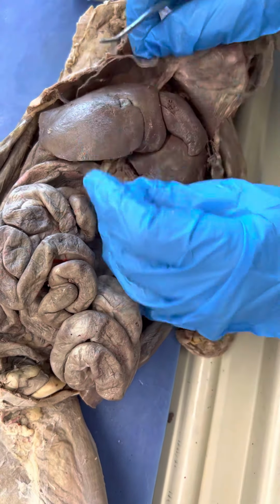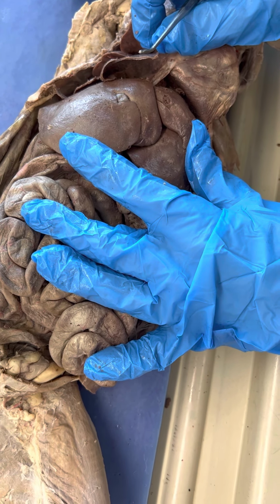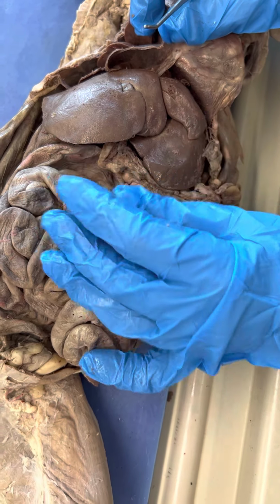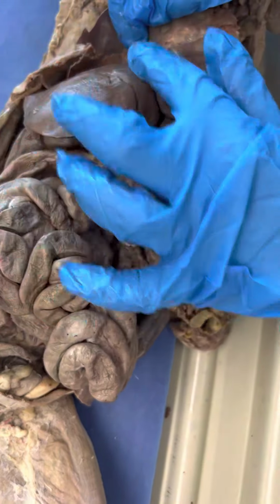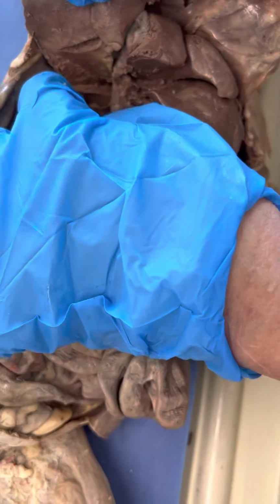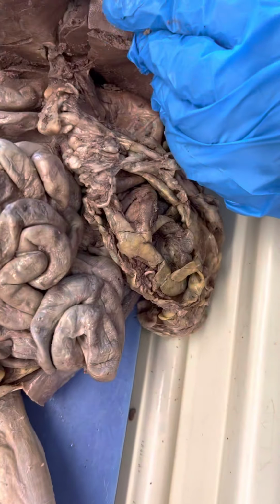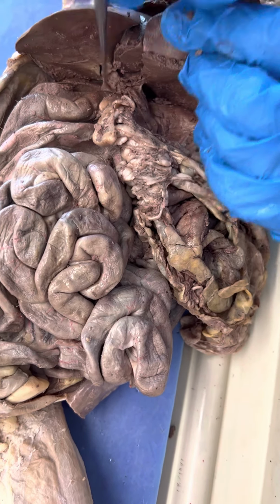Okay, so then you have your liver, and you have your right median and your right lateral, and you have your left median and your left lateral, and you have the quadrate and the caudate lobes. Okay, right median is pretty big, has the gallbladder on it. Right lateral is down there, small. On the left side, the left median is small, the left lateral is big, and those other two, I'm not going to dig them out, but they're down in there. I would take a look at some of the pictures. Okay.